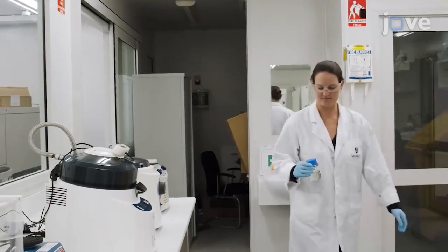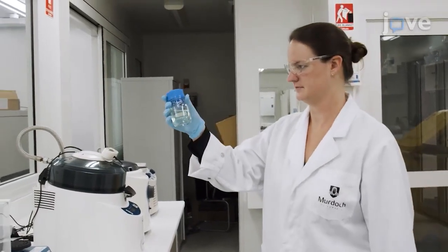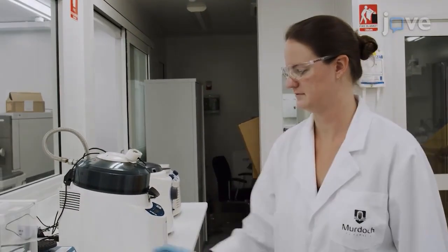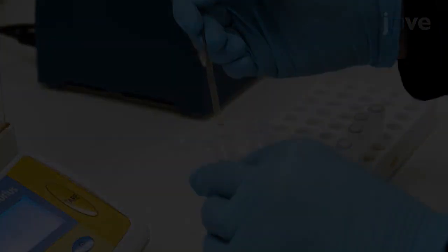On the same day as the extraction, prepare the extraction solvent as described in the manuscript. Next, weigh 200mg.